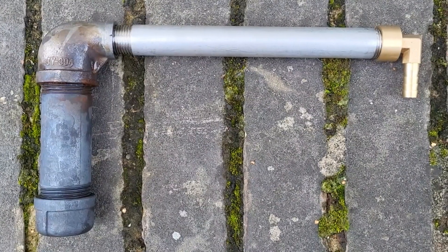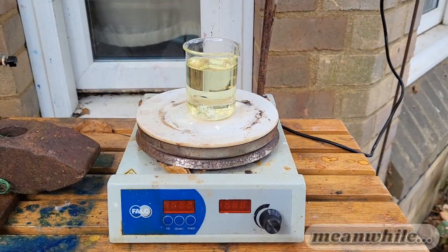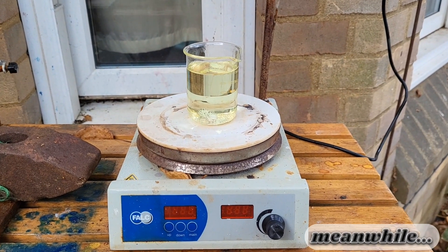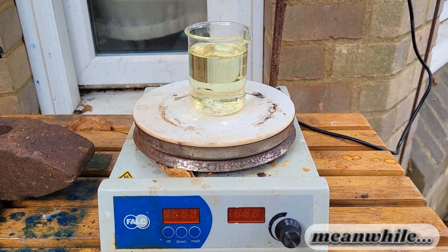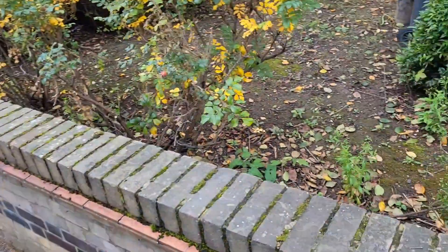Today we're going to try and distill some potassium. Evaporating down the last of this methylamine solution, I noticed that a lot of bubbles were being formed. I think that was the beginning of decomposition. I'm going to have to evaporate this more gently — there were lots of bubbles when it was hot and stirring. One thing at a time.